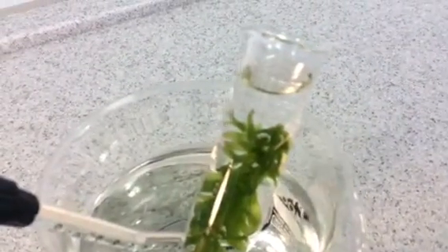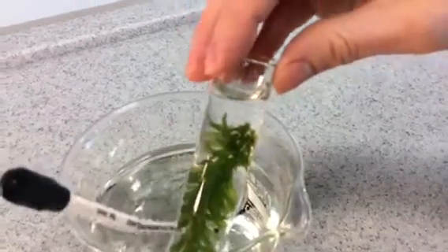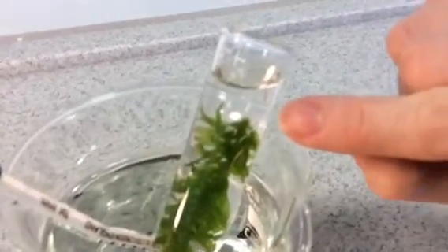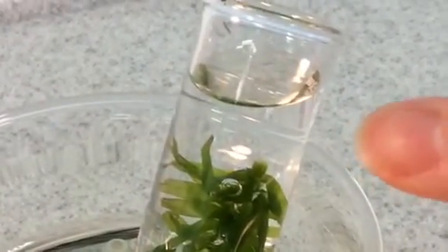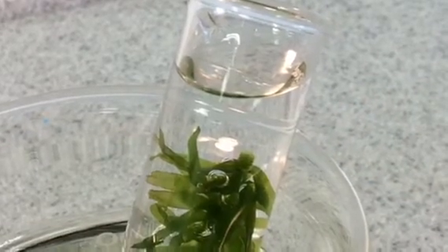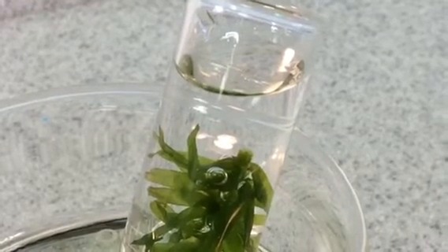Now I want you to pop in your thermometer just to be checking that that temperature is monitored. Okay? So I want you to focus in on the cut end of the pondweed. So we're looking, oh, there was one. So I want you to look for bubbles coming out of the cut end, and they will be oxygen bubbles, proving our pondweed is photosynthesizing. Now we're going to be counting, there you go, counting the bubbles, how many are produced in 1 minute at this distance. So we'll do that now.